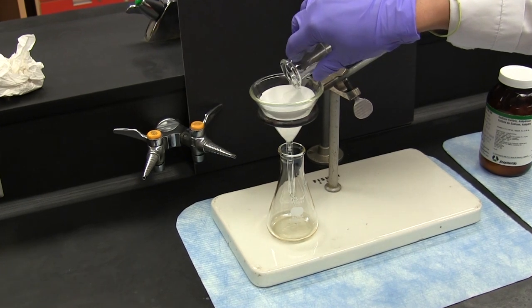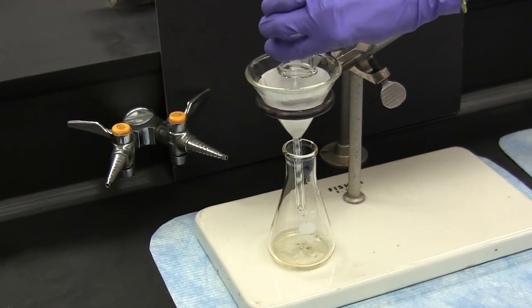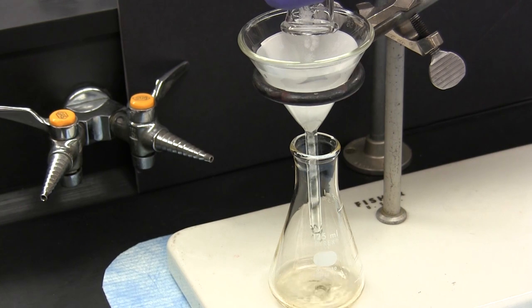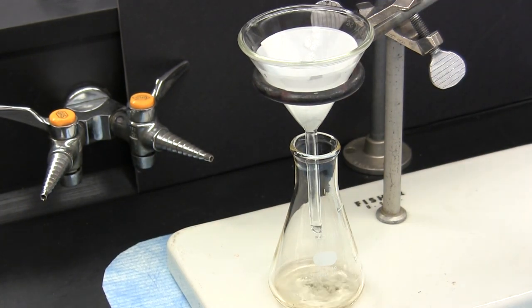The drying agent can then be removed by gravity filtration. And then you can follow any further directions on how to proceed.